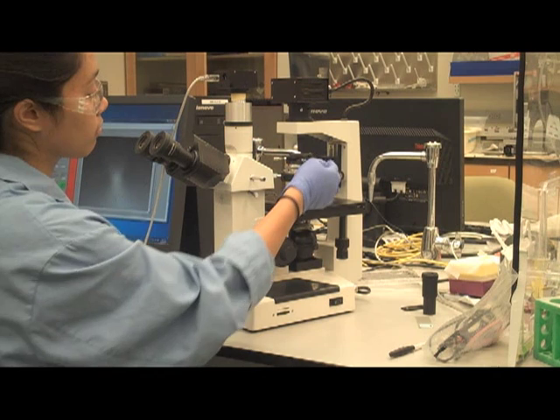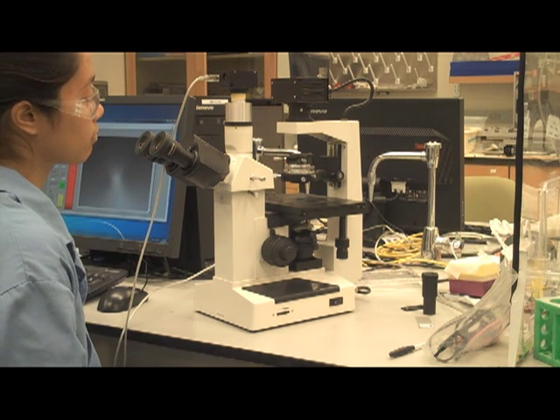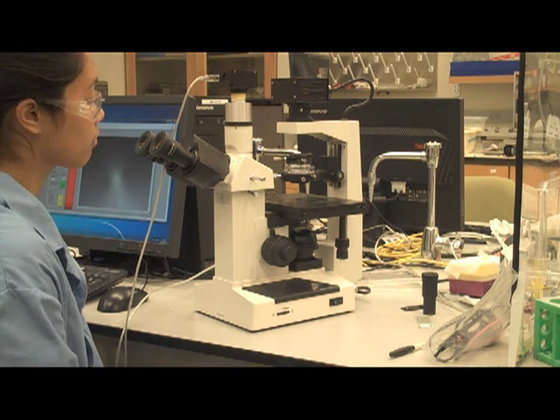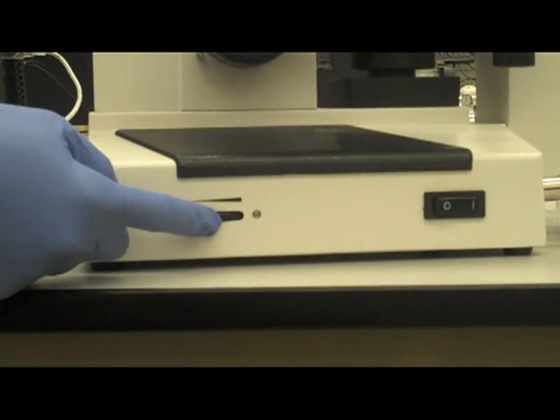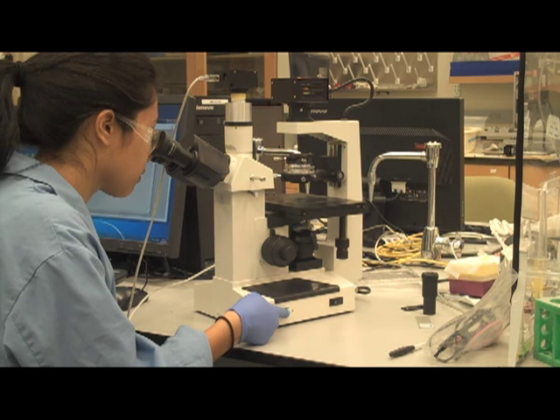Step 4: Turn the aperture dial counterclockwise until the dial stops to open the aperture and allow for light to pass through. Step 5: While looking into the eyepiece, adjust the light control located on the side of the microscope towards the base.